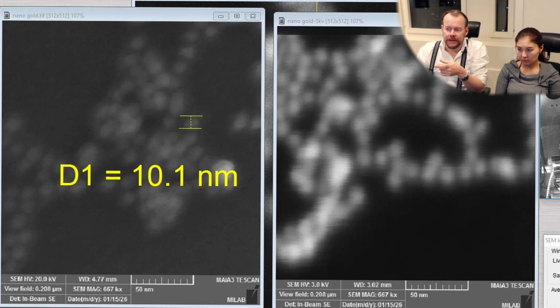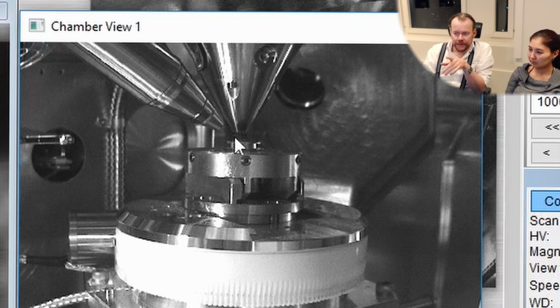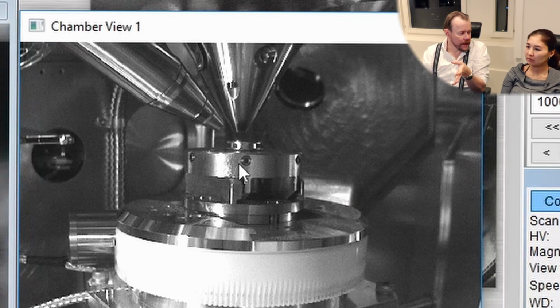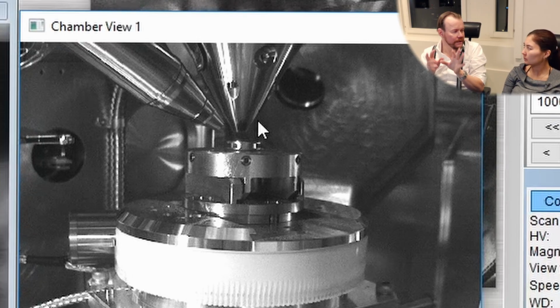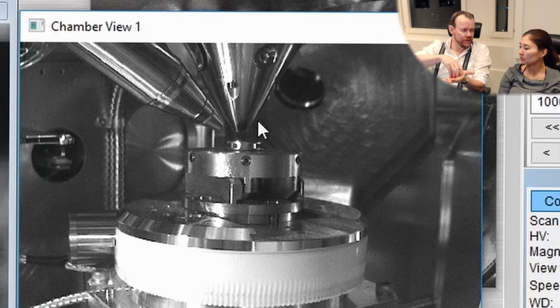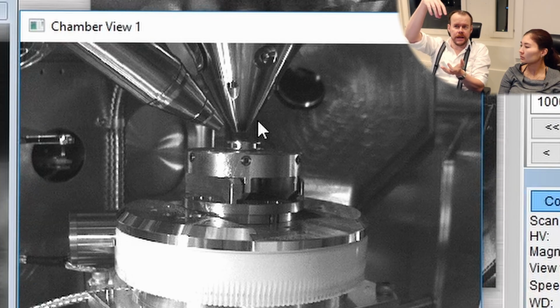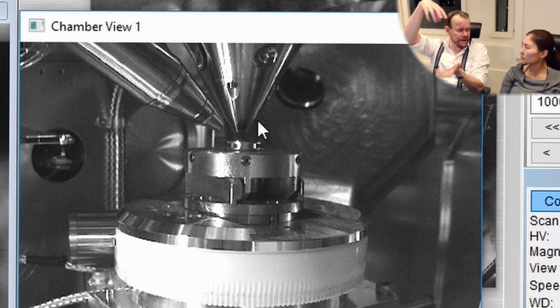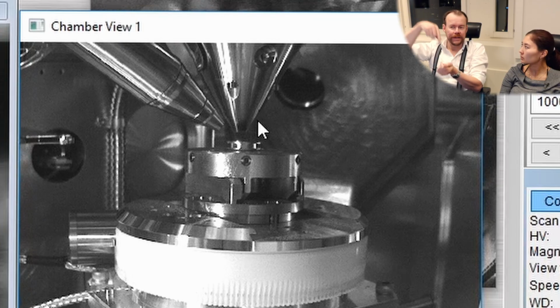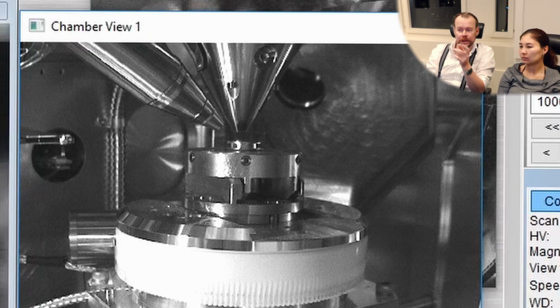So this is the case when you would like to use this beam deceleration mode. What it does, if we look at the stage here, is that in beam deceleration mode it will put negative 5 kilovolt on the stage. So that means it will repel the electrons. So if we have 3 kilovolts now, then we shoot from 3 kilovolt and go to 0 potential. But if we raise the stage to 5 kilovolt, then we can have 8 kilovolt on the gun, and the difference will still be 3. But for most of the path in the column, the electron can use the high voltage. So the resolution is improved by doing that.